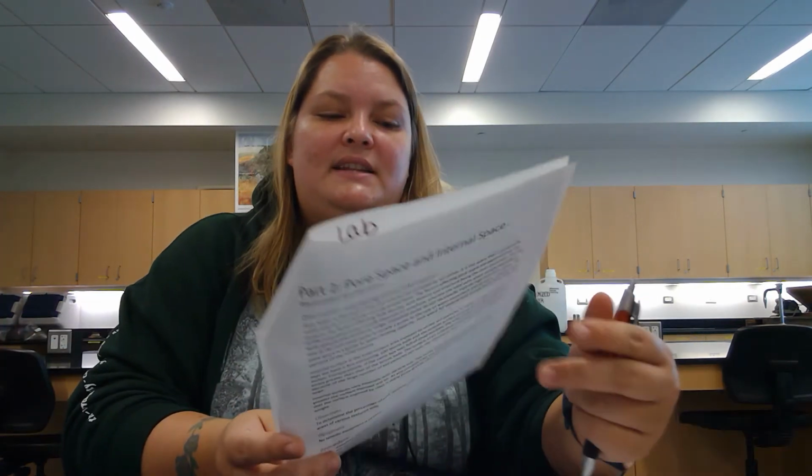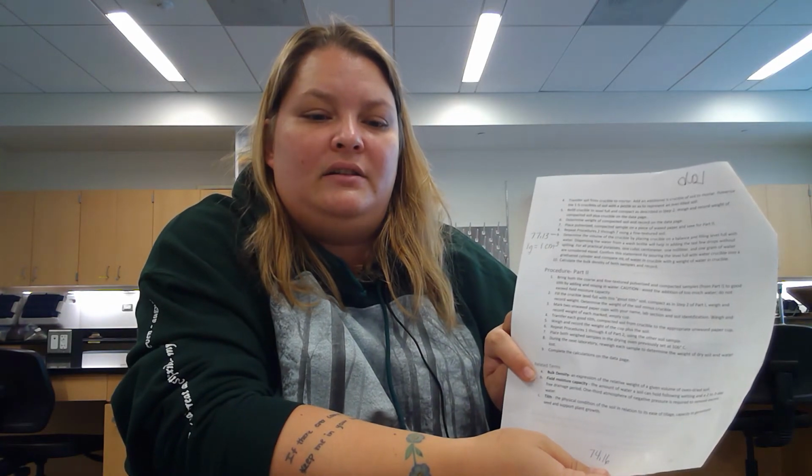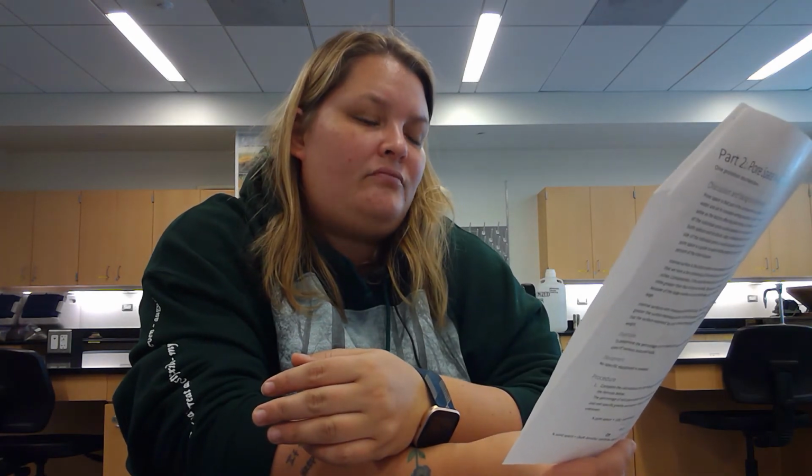Part 2 for bulk density is taking those samples I set aside on wax paper and bringing them to good tilth. If you look through the lab report, there are sections on important terms to know. We want to bring it to what we call field moisture capacity, which is the amount of water soil can hold following a rain event and then a 2 to 3 day drainage period. So it's basically filling up those pores with water, but not too many of the air pores.